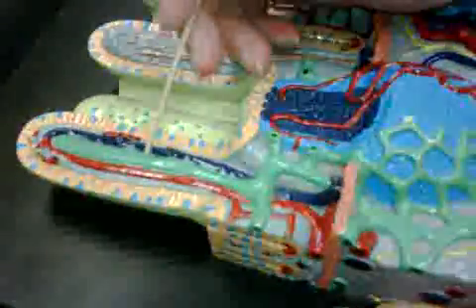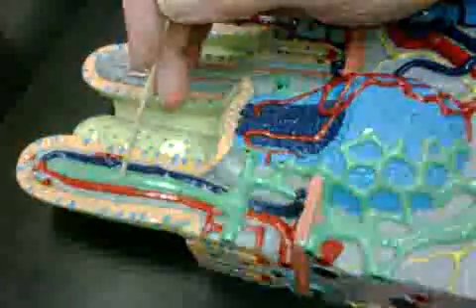Okay. Lacteal. The lacteal is this greenish thing. It's got lymph running through it. It's a lymphatic vessel, but it's a dead end, so they call it a lacteal. Fats get absorbed into the lacteal, whereas carbohydrates and amino acids get absorbed into the capillary net.